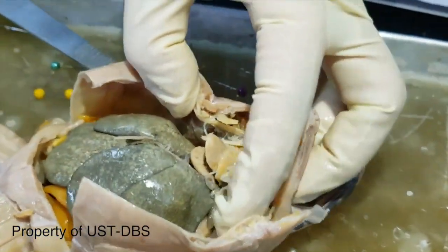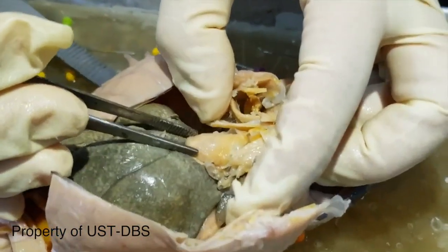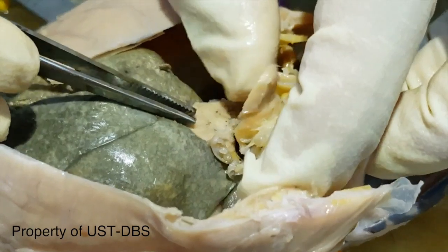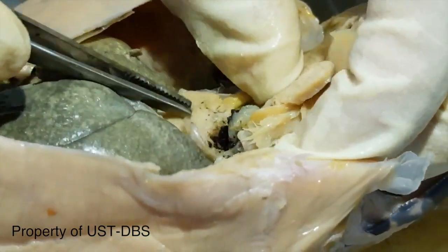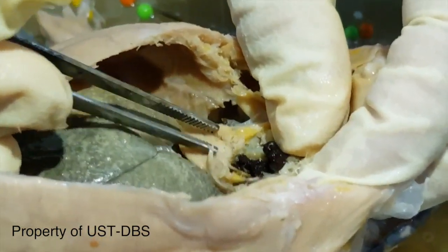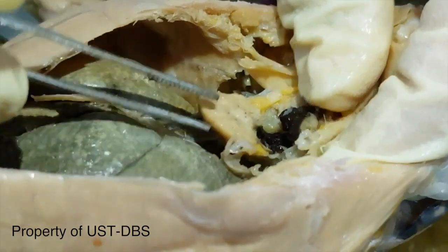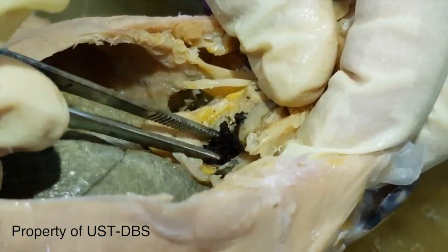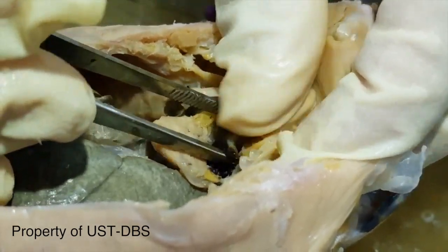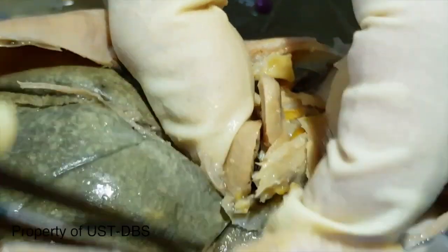So this structure that I cut is the heart. I cut it on a section that will reveal the chambers. This thick portion here is the ventricle, and those on the top are the atria. You see that there is still blood present.